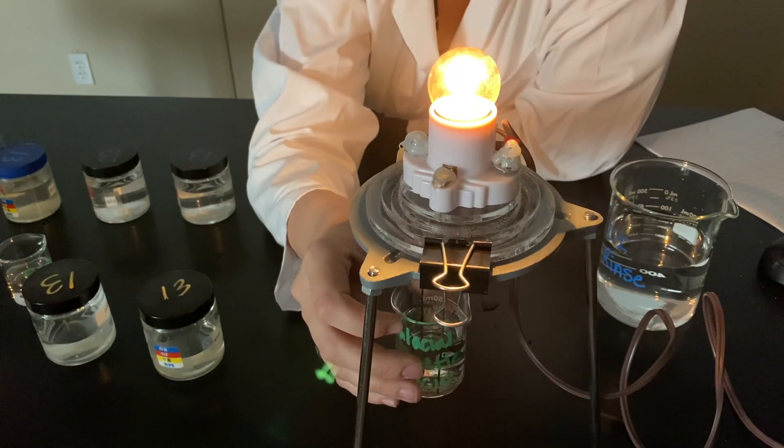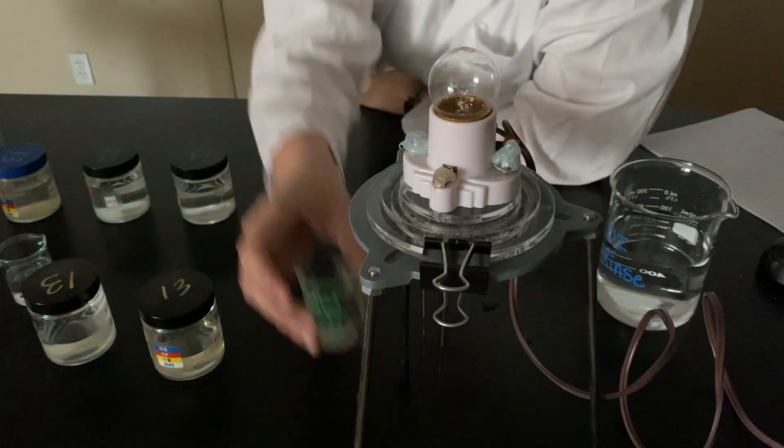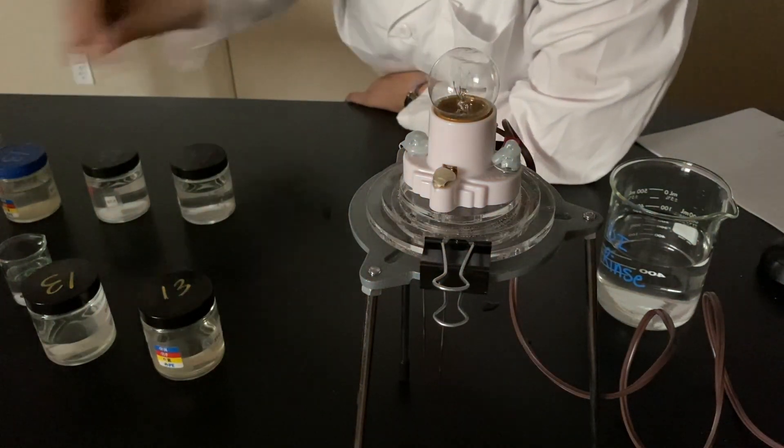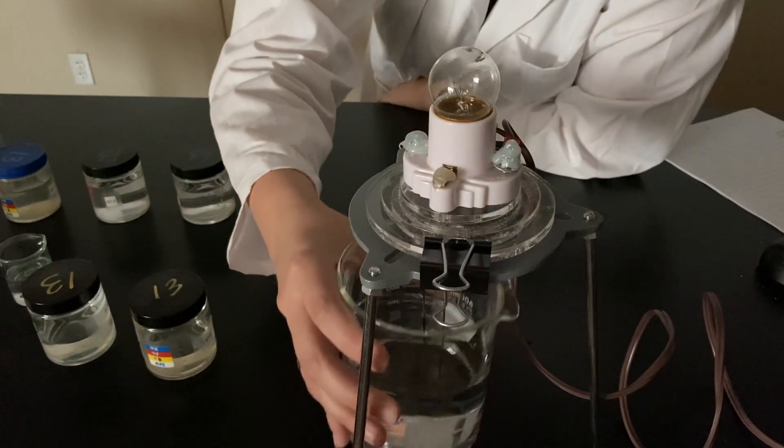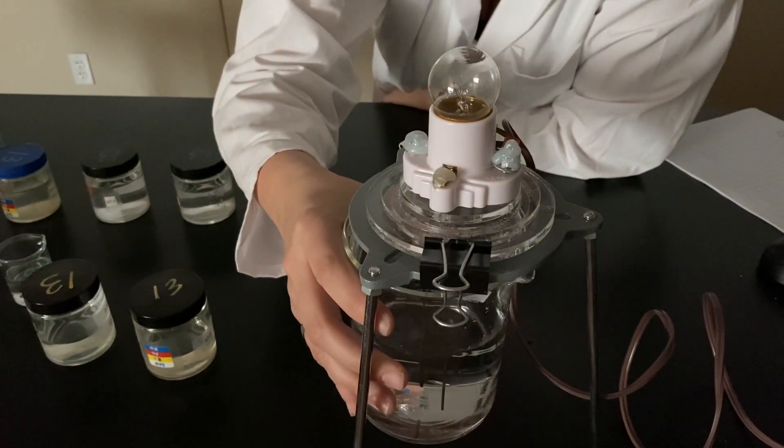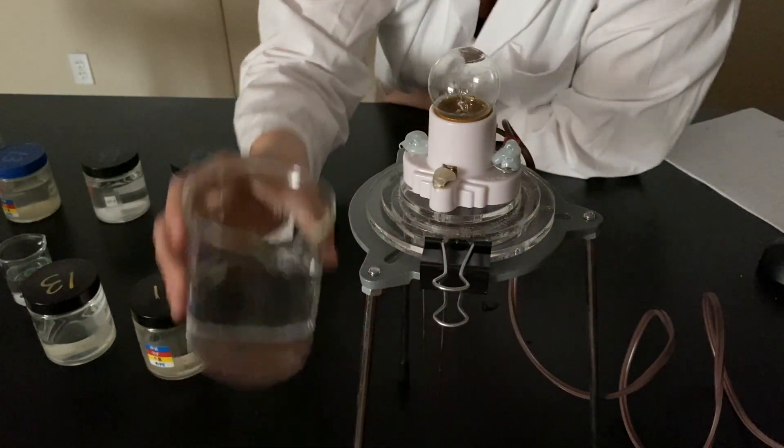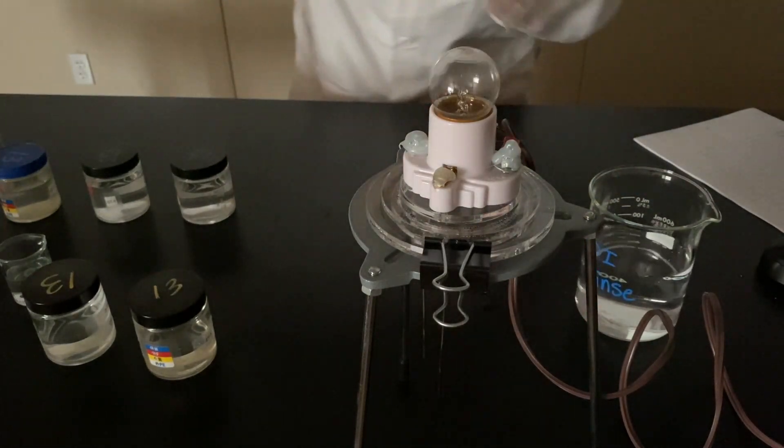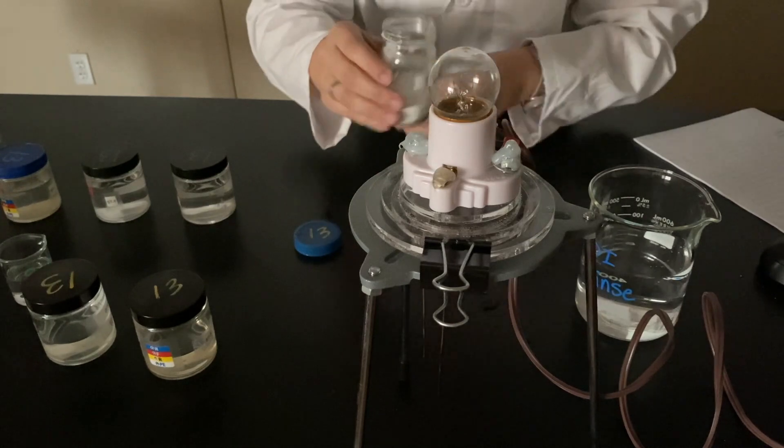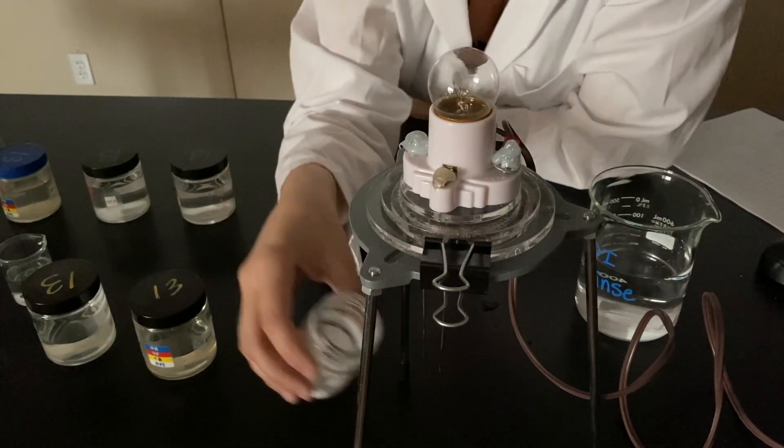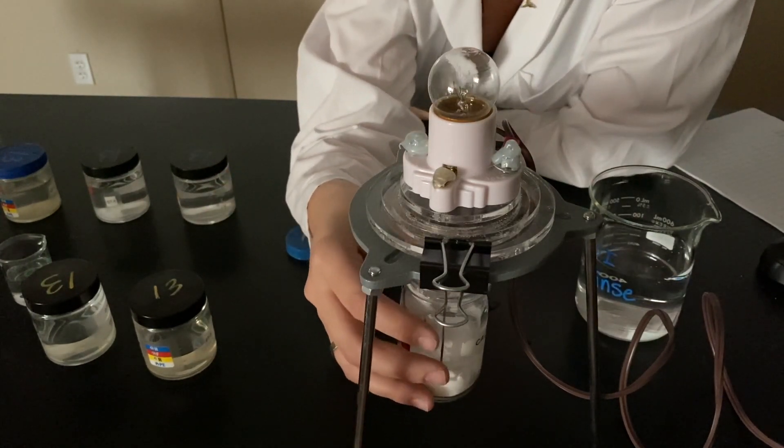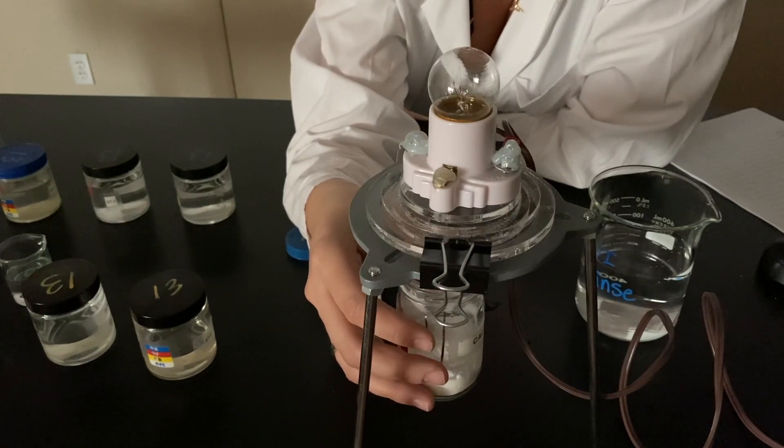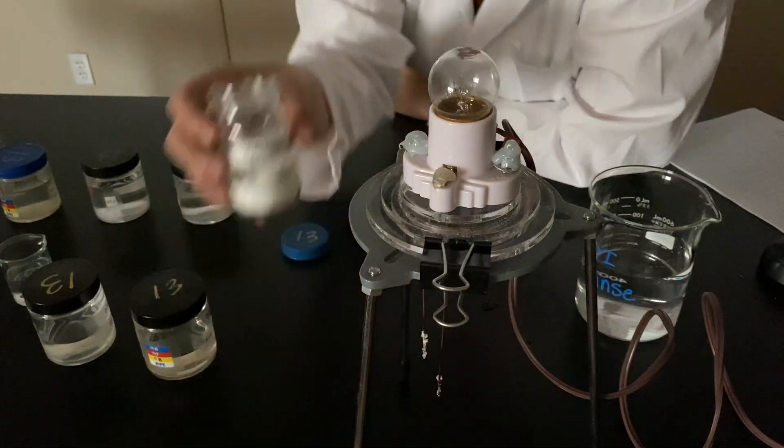Definitely not quite as bright as our sodium chloride, right? DI rinse. The air conditioning comes on. All right. Calcium carbonate as a solid. We all saw that coming.